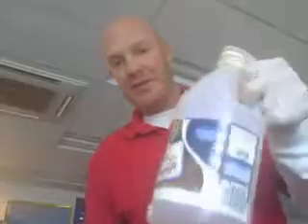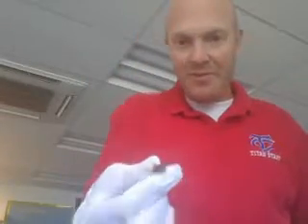But the whole point of this little demonstration is to demonstrate the effects of pH on enzyme reaction rates. And it's really a simple demonstration. We just use vinegar, we use baking soda, and we use water, and of course our hydrogen peroxide and the little beef liver there to demonstrate that. Beef liver, remind you, has the enzyme catalase, which is going to break down hydrogen peroxide. The catalase is going to bind to the substrate, hydrogen peroxide, and break it down into oxygen and water. The oxygen is the little bubbling that you see, and the water is the leftover liquid.